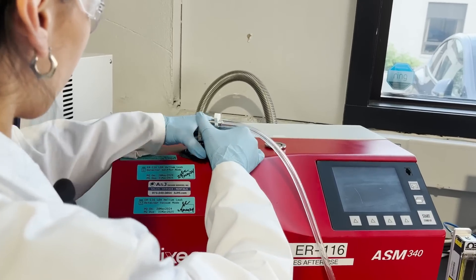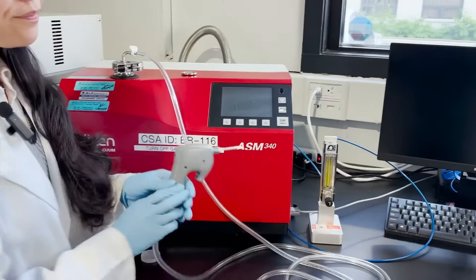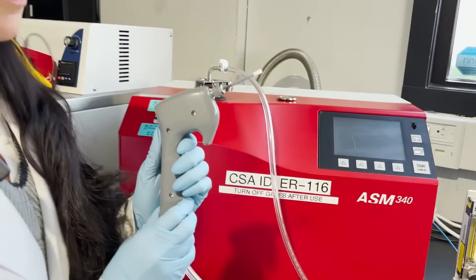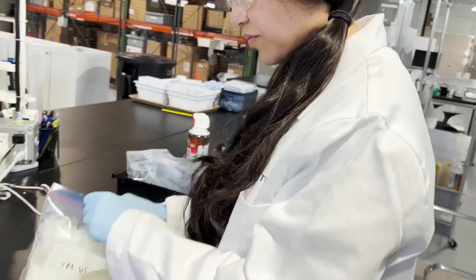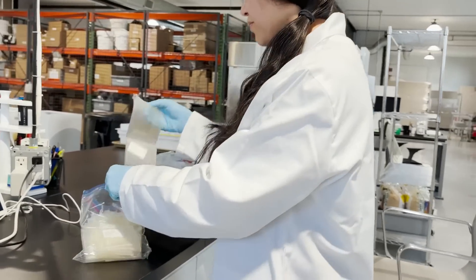In the ASTM, these are procedures A and B respectively. In vacuum mode, the instrument pulls vacuum on a sample such as a vial or syringe, affixed to the top port of the instrument by way of a customized fixture. Here at CSN Analytical, customized fixtures are uniquely fabricated for the client's package system.